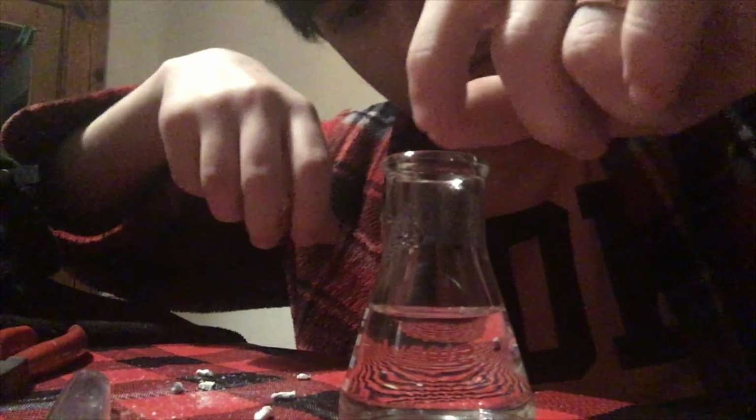Sorry, the camera cut out again. Another thing calcium does is it reacts with water to produce hydrogen. So let's take a little piece like this one that we've exposed a little bit of the surface of the metal of. We're going to drop it into this little vial of water. As you can see, it's vigorously producing a chalky substance.